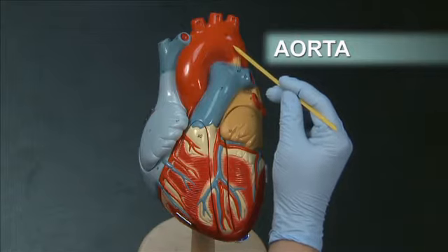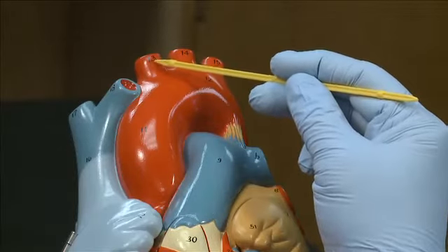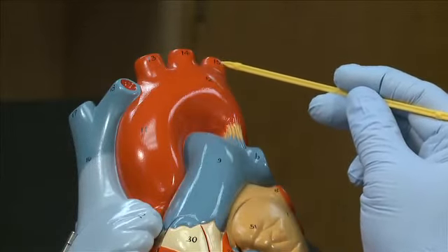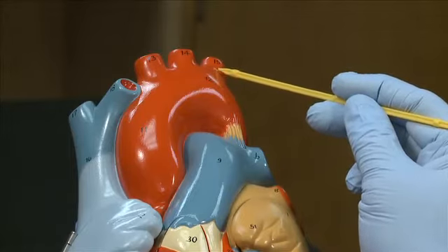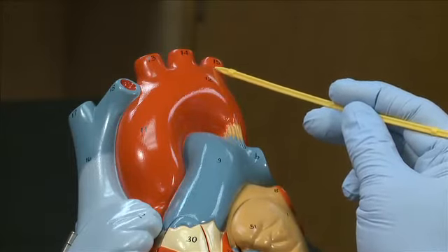In humans, the aorta has three branches, but in the sheep heart you'll only see two branches off the aorta.